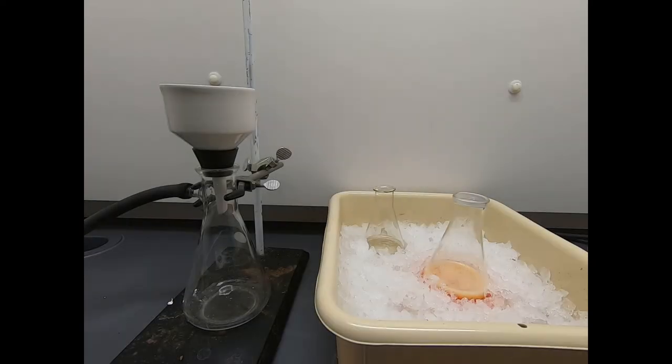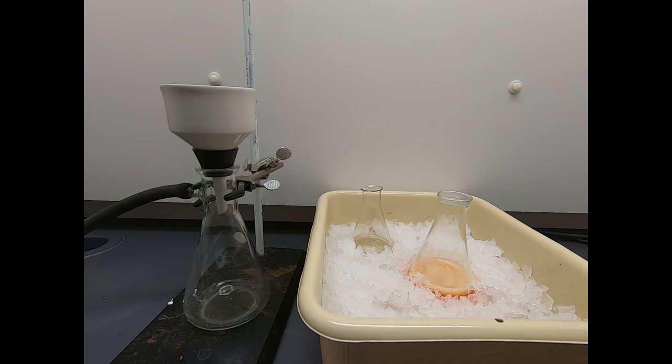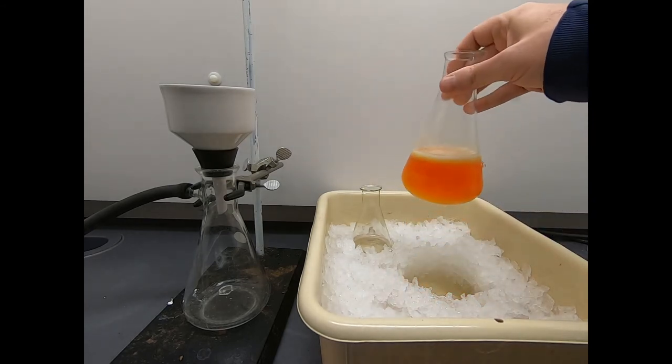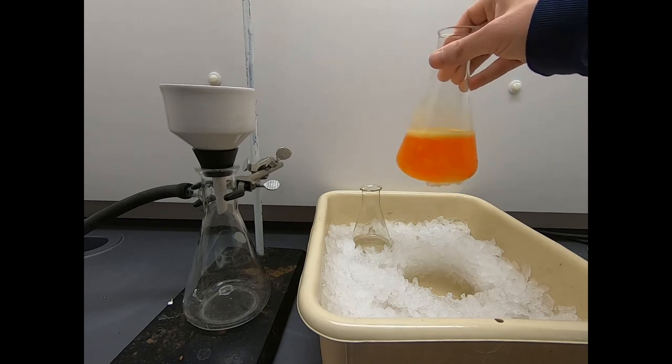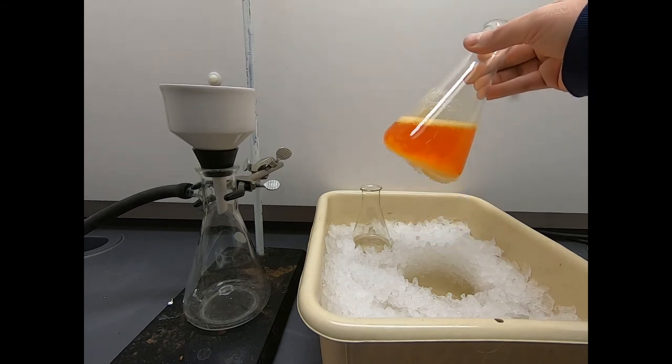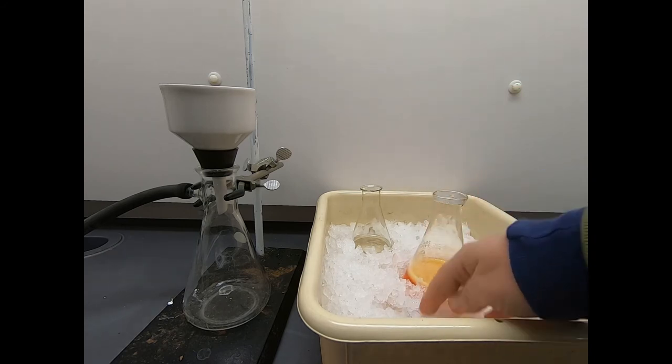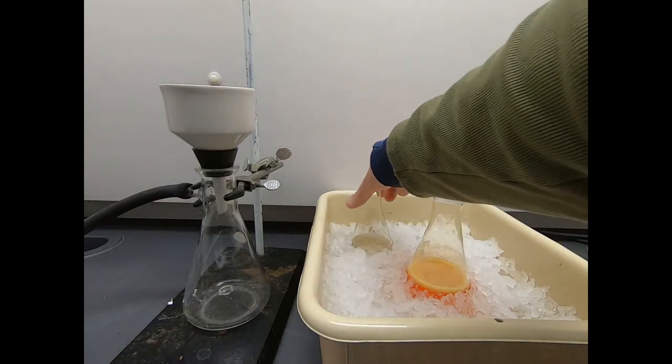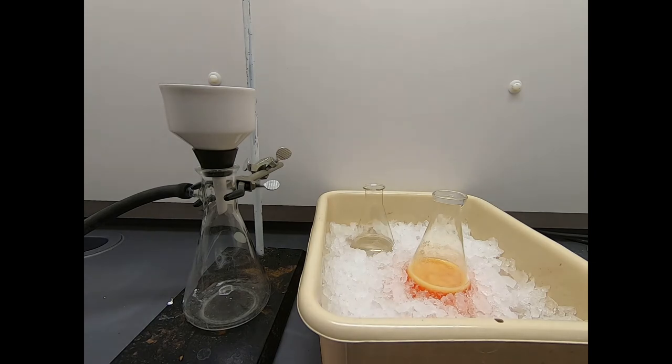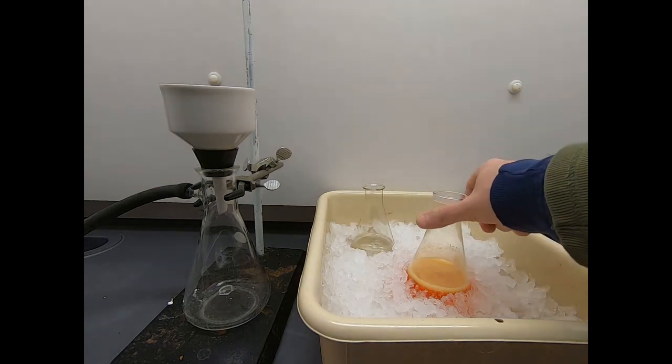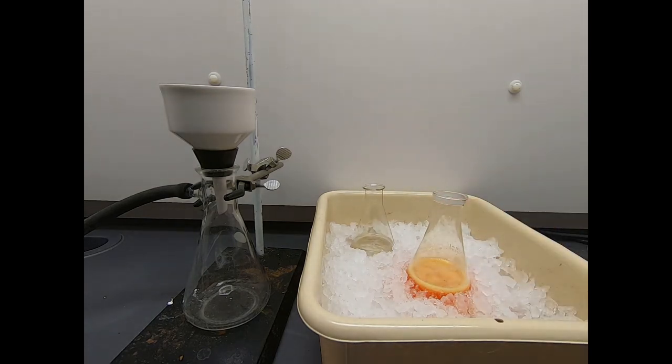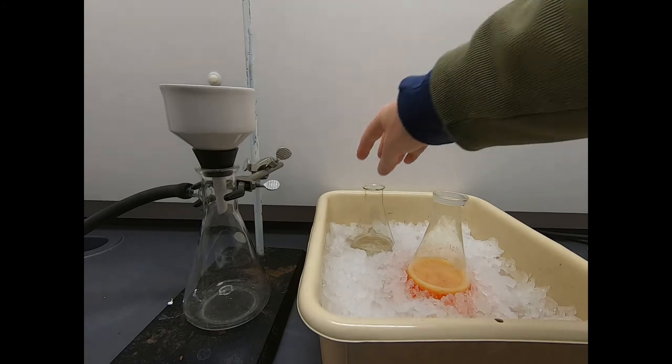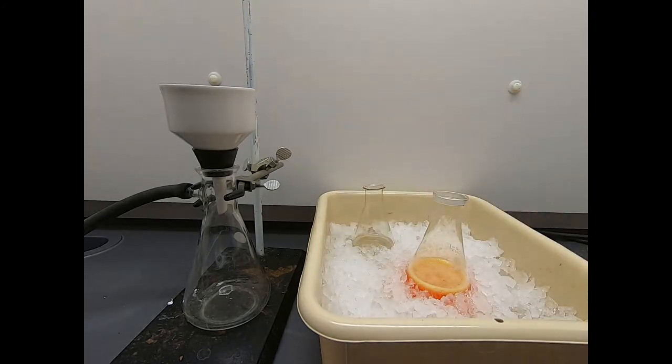So a lot has happened since our last clip. Everything's on ice. Here's our material. Notice we got all this solid. I don't know if it's colorless, but it's nearly colorless what's floating in there, and the color seems to be staying in the aqueous layer. So that's on ice, nice and cold. Hopefully everything has now precipitated out of solution. Back behind it, I have some water that I also have on ice. We ultimately have to filter this material, and when we do the filtration, we're going to rinse it with additional water. And to make sure we minimize the amount of any solid that would dissolve in that water, we're going to try to make sure that water is nice and cold. So you normally have pre-chilled solvent when you do a filtration.